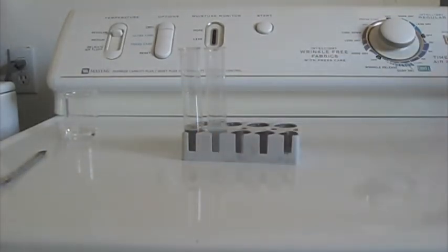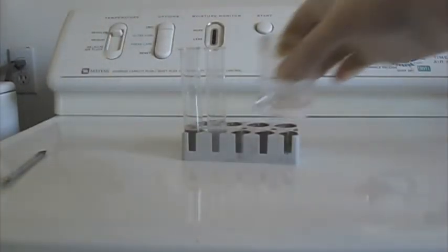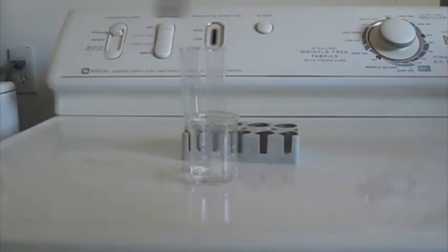Add a small amount of the corn starch water to the hydrogen peroxide. There's some water in a beaker.